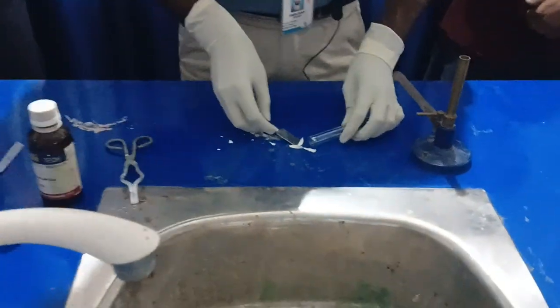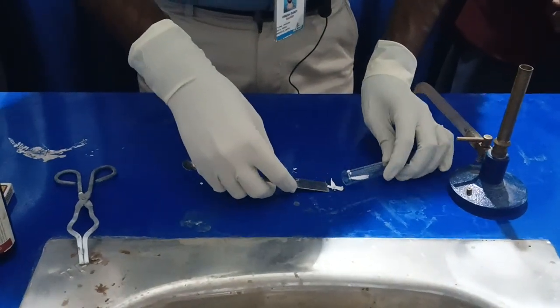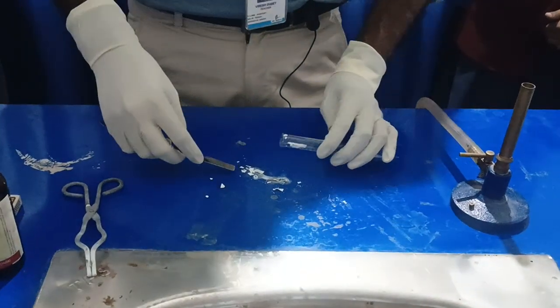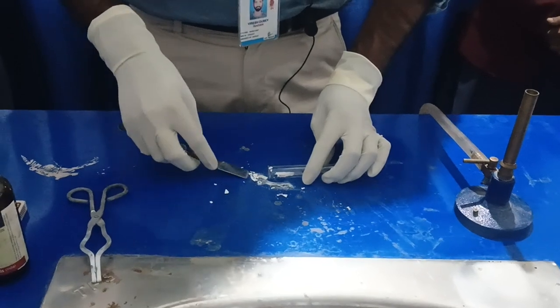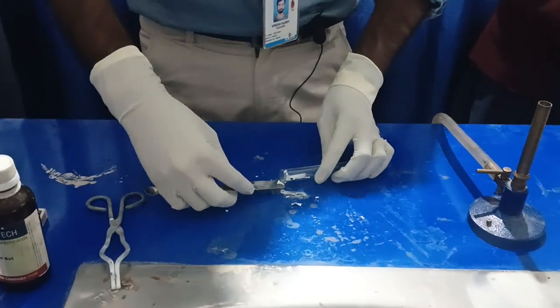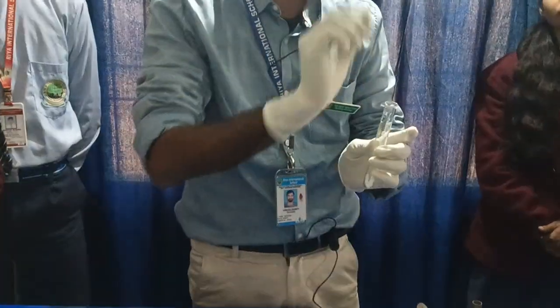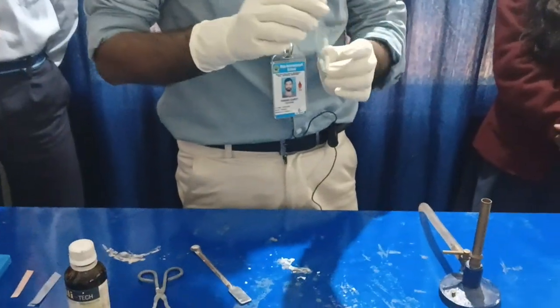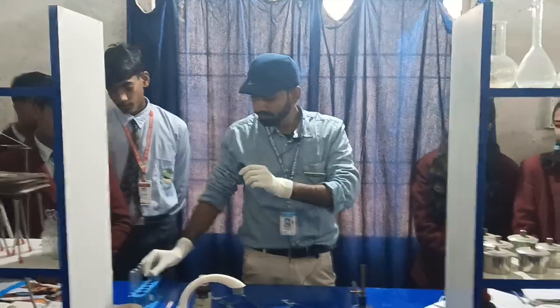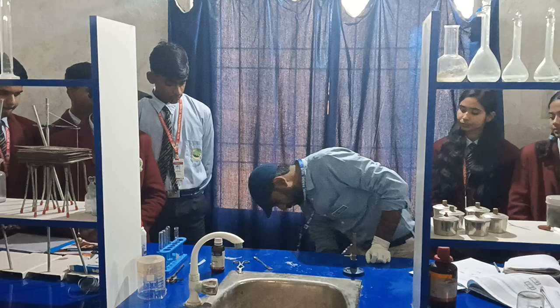Now we will put the ash into a test tube and dissolve it in water. When we dissolve it in water, we will obtain magnesium hydroxide. Not all of the magnesium oxide will dissolve, because it is a very slow process, but some will dissolve to form magnesium hydroxide. Then we will observe whether magnesium hydroxide is acidic or basic.